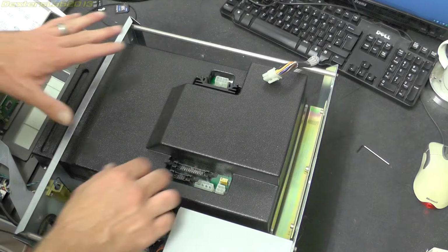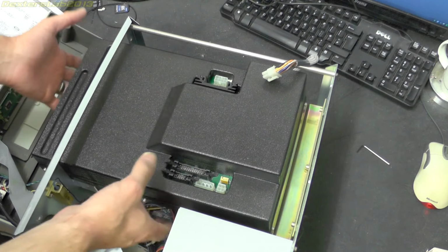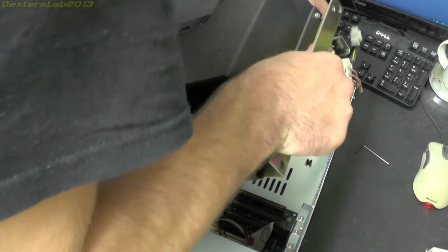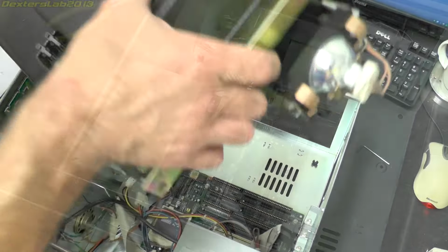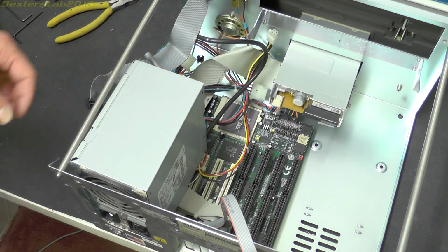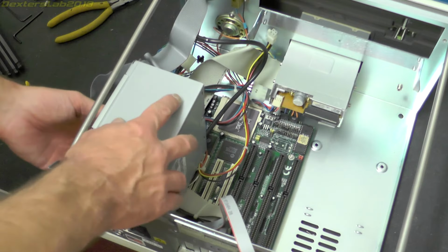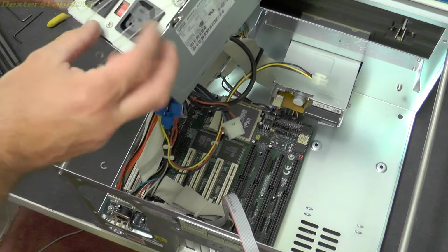Right, I've just released all the screws to this part, which seems to be all the science part. So I'm just going to try and get this to come out of here. Hopefully it will. Yep, there we go, one complete unit. Okay, you can see here now I've got the science bit out of the way. I've just turned it round just so we can have a look at the PC element of this. I have also just released the screws holding in the power supply. So I'm just going to pull this out of the way and we'll see what we've got.